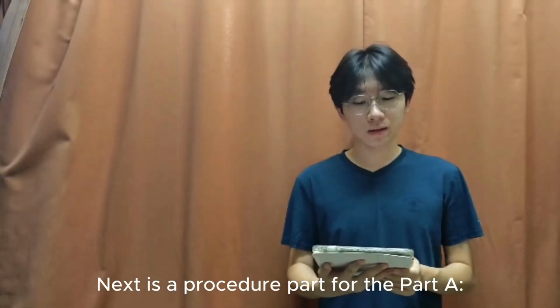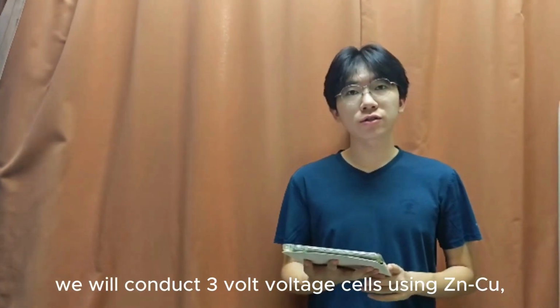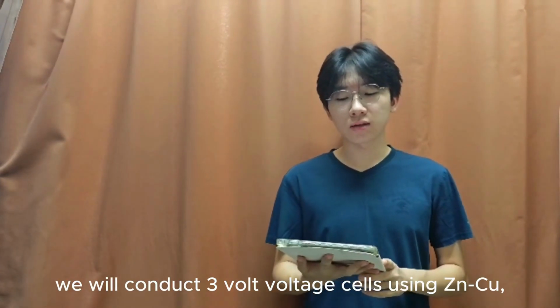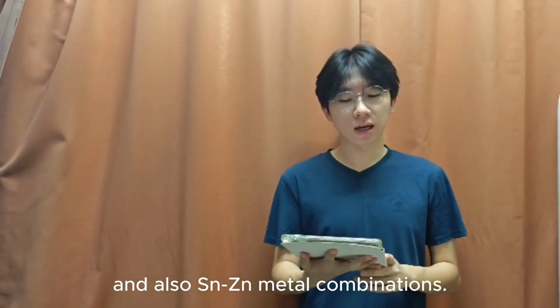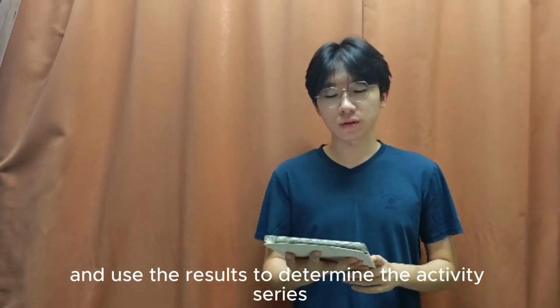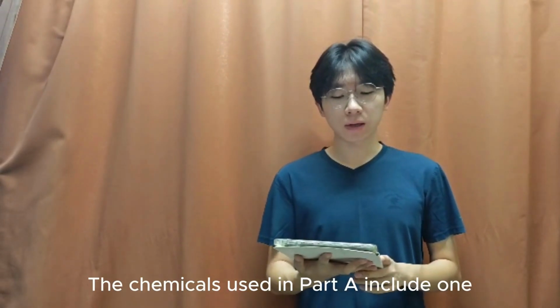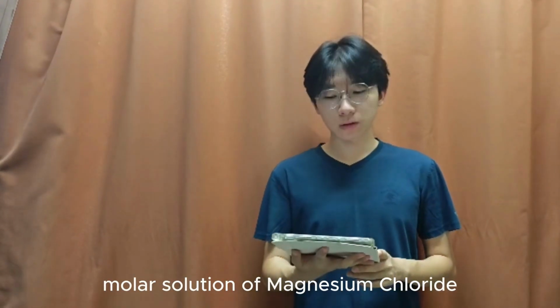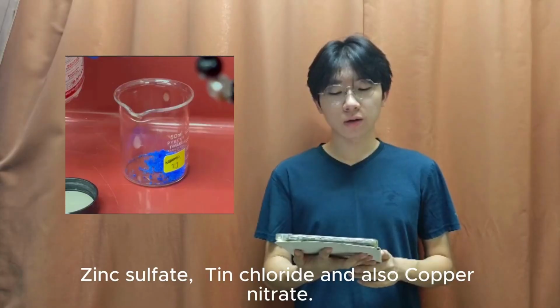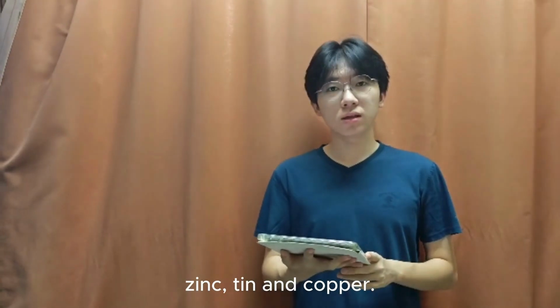Next is the procedure for part A, determination of cell voltage. In part A, we will construct 3 voltaic cells using Zn-Cu, Mg-Zn and also Sn-Zn metal combinations. Our goal is to measure the cell voltage and use the results to determine the activity series of the metals involved. The chemicals used in part A include 1 molar solutions of magnesium chloride, zinc sulfate, tin chloride, and also copper nitrate. We also use metal strips of magnesium, zinc, tin, and copper.